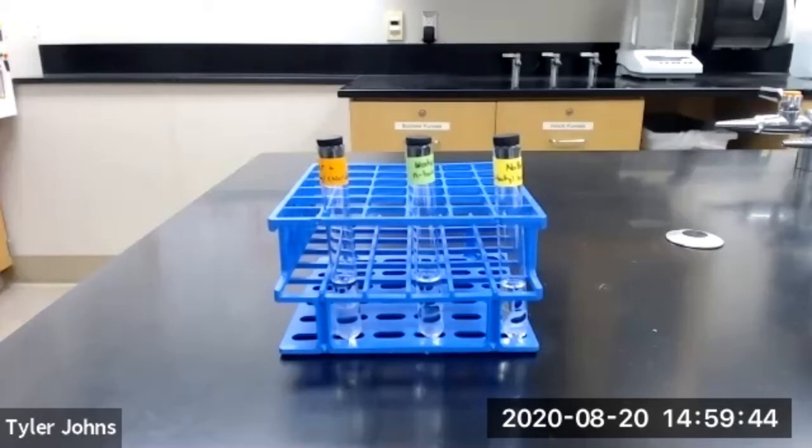In part C of this experiment we will learn how to determine which is the organic layer of two immiscible solvents. We'll do this by adding several drops of water to the top layer.